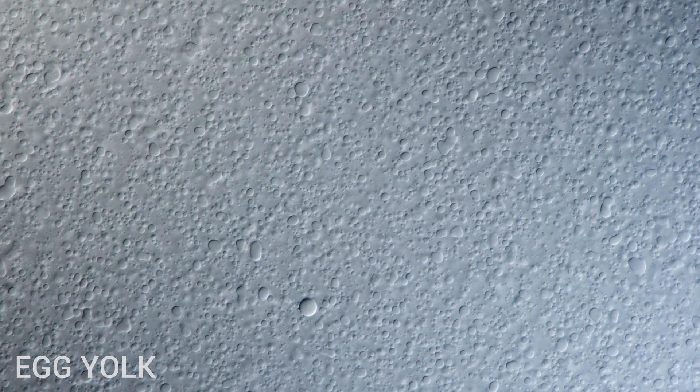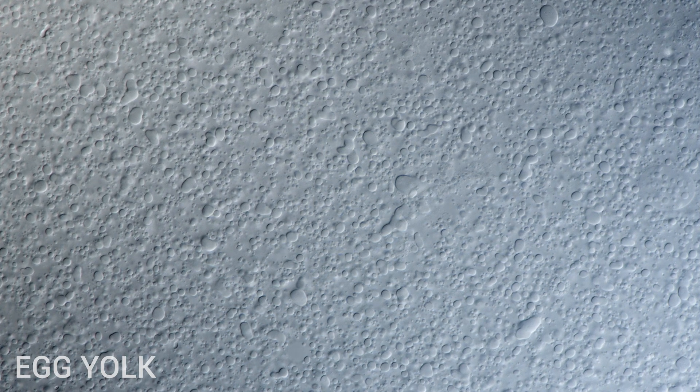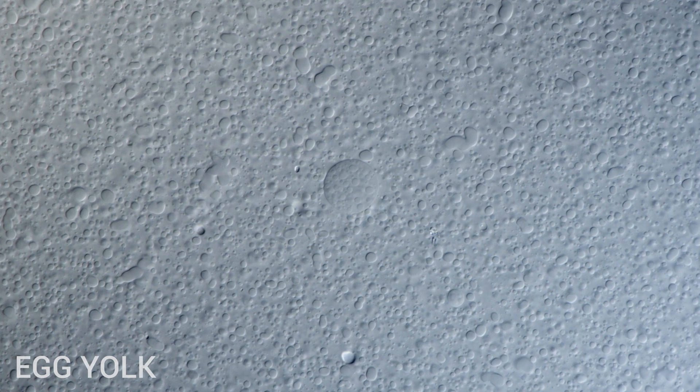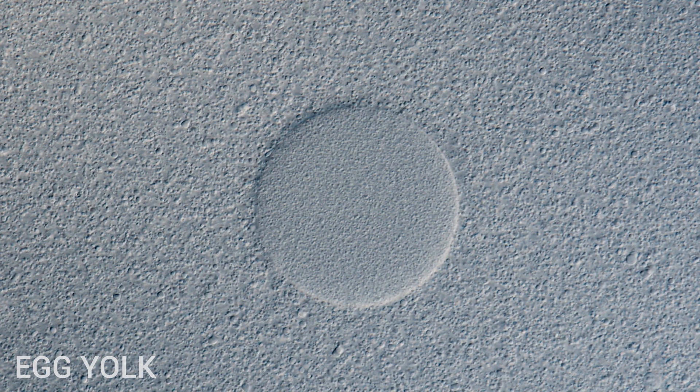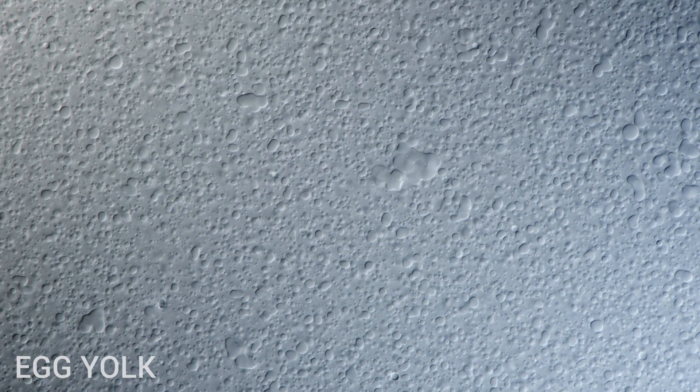Now let's take a look at egg yolk. Yolk is also known as Vitellus and weighs 33% of the entire liquid portion of the egg. A chicken's egg yolk is a major source of vitamins and minerals. It contains all of the egg's fat and cholesterol and nearly half of all available proteins. Yolk's primary function is to supply food for the development of the embryo — that explains why Vitellus is packed with so many nutrients.